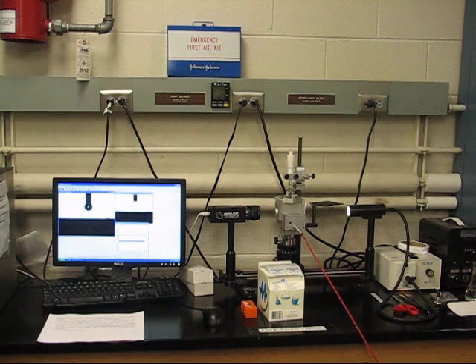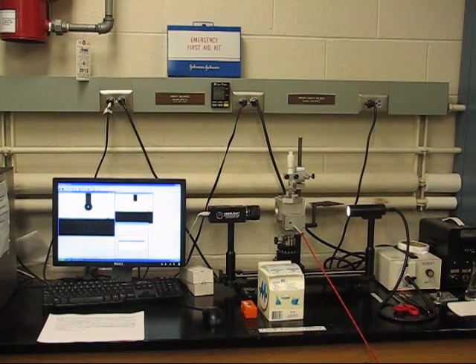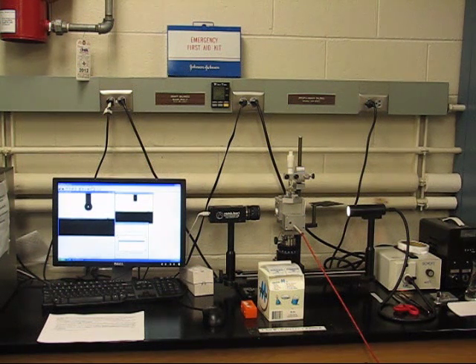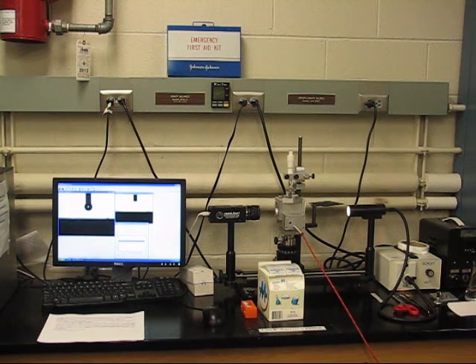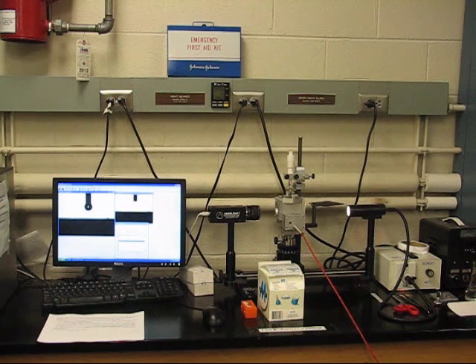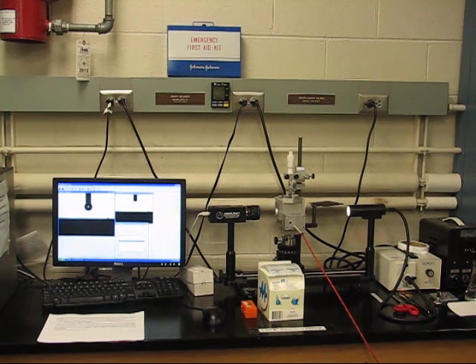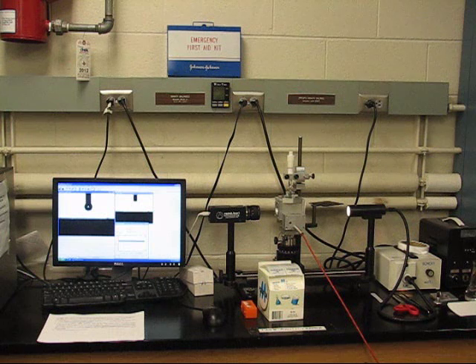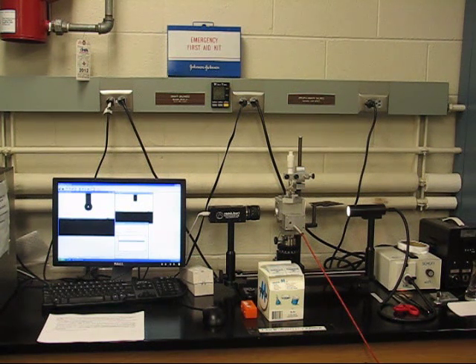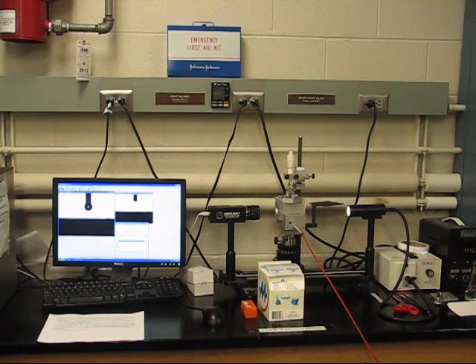Wettability plays an important role in the production of oil and gas, as it not only determines initial fluid distributions, but also is a main factor in the flow processes in the reservoir rock. The degree of wetting of solids by liquids is usually measured by the contact angle that a liquid-air interface makes with a solid.